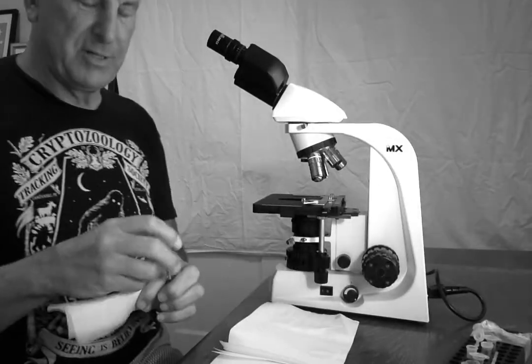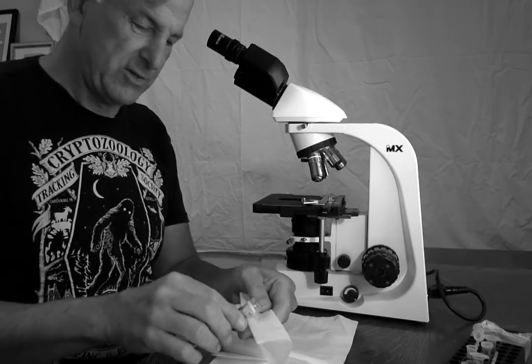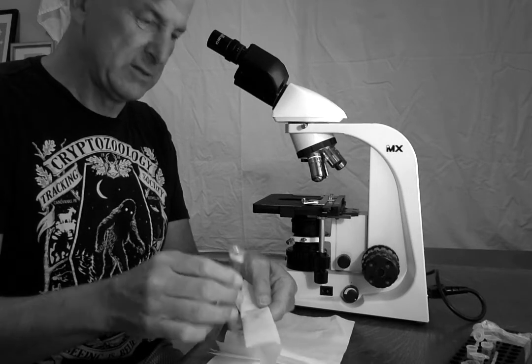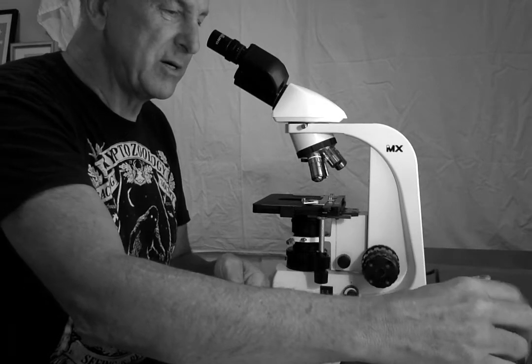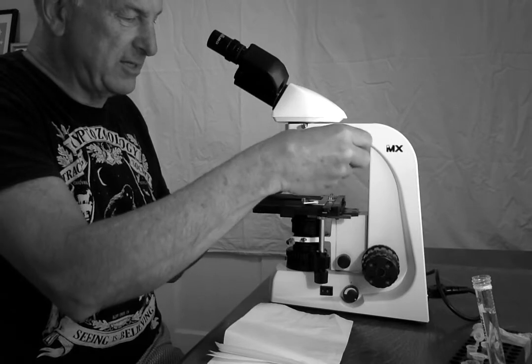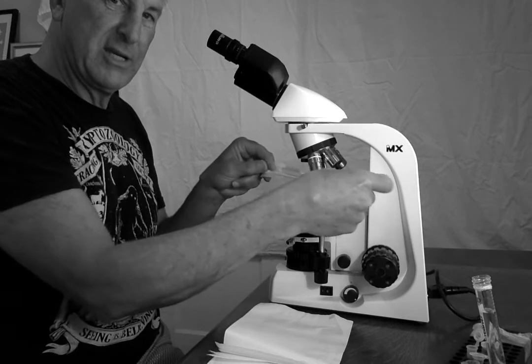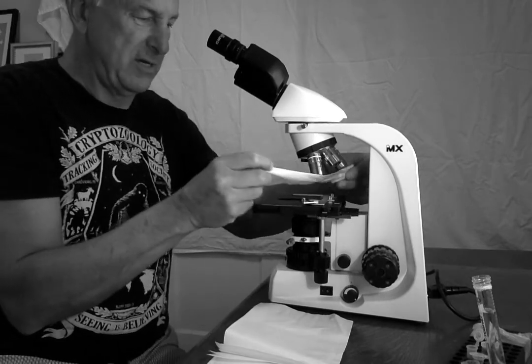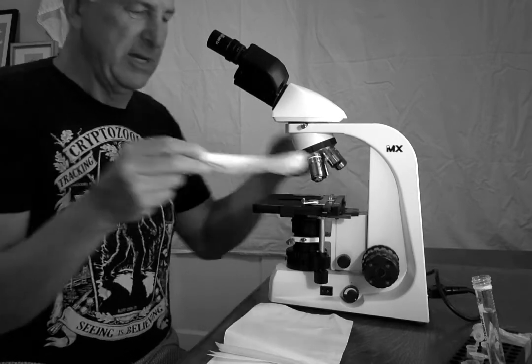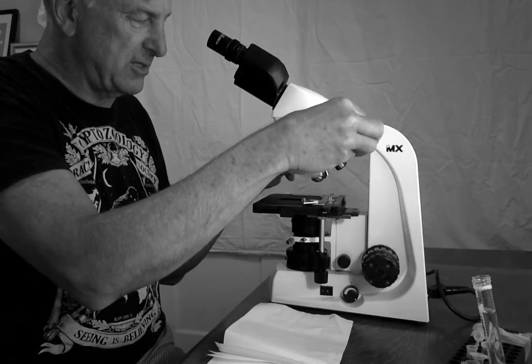I'm going to add a little bit of the lens cleaner fluid. I wish I had another dropper, but I don't, so I'm going to just carefully pour a little drop on here. And probably spill that now. Oh no. And now with a little of the lens cleaner fluid, I'm going to wipe back and forth again. Let's see another view of that. Go back and forth, wiping action. And I'm going to keep doing that till I'm convinced there's no oil on this lens.